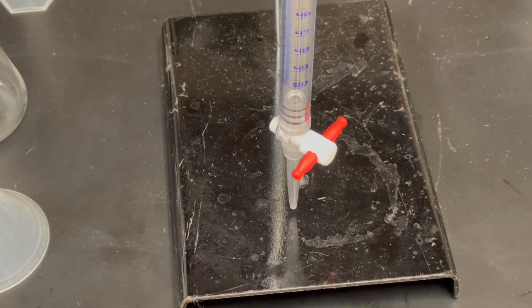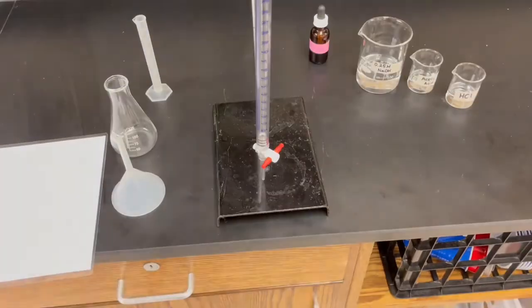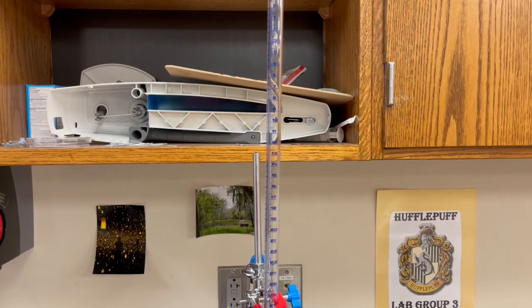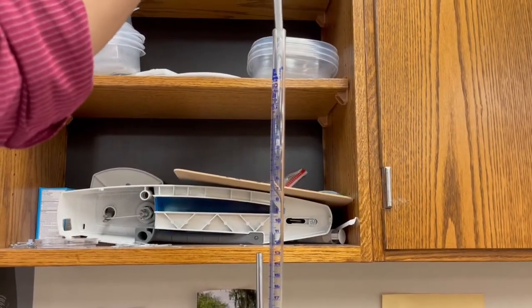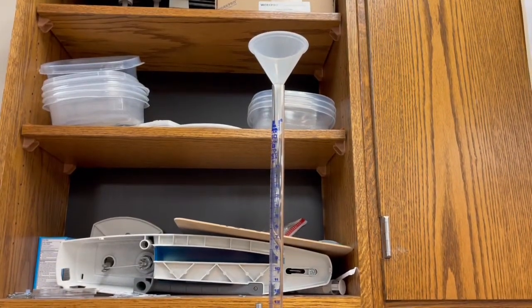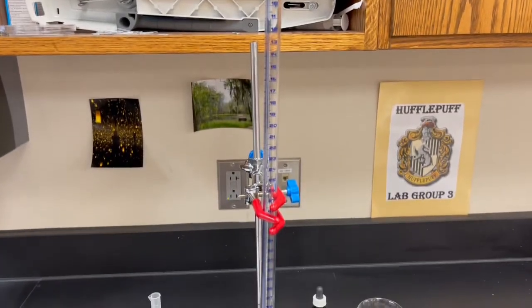So we're going to place a funnel at the top of our burette. Taking a funnel here, putting it at the top, so that I could easily pour my base, the titrant, into the burette.